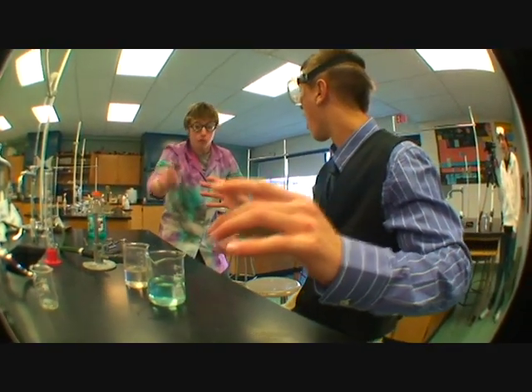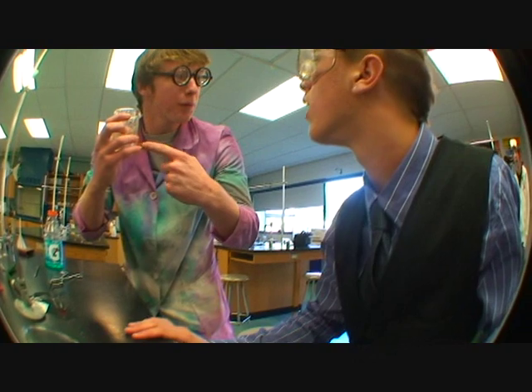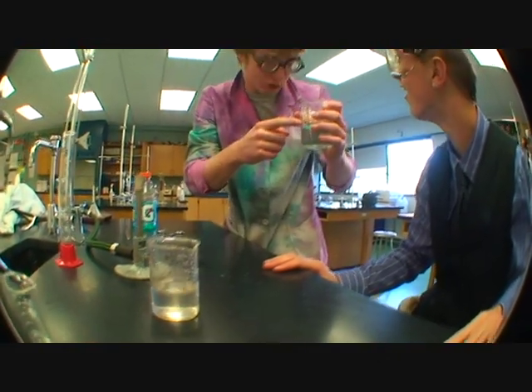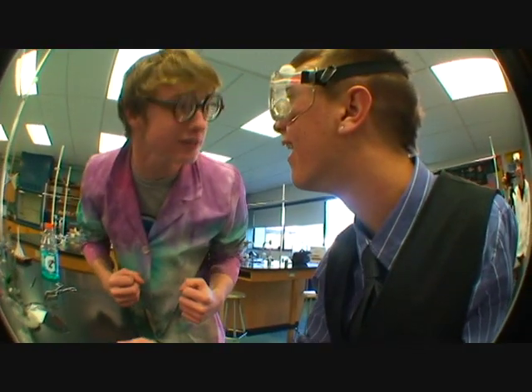Did I instruct you to do that? Do you know if you had just poured this super atomic acid into this Gatorade mixture, fusion of fun, that you would have blown up half of Kansas?